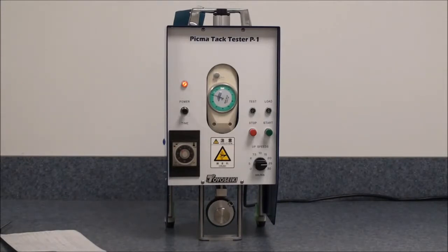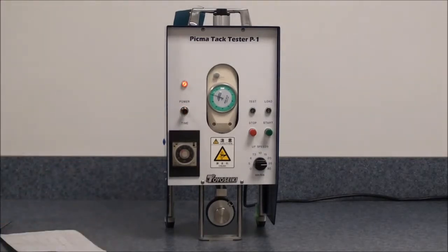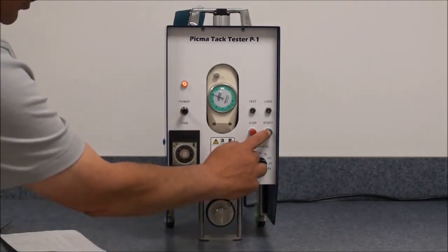To operate the machine, it is as simple as turning on the power and then pressing the start button.